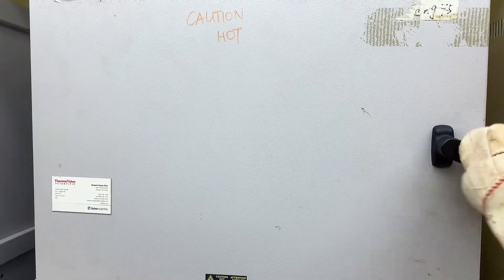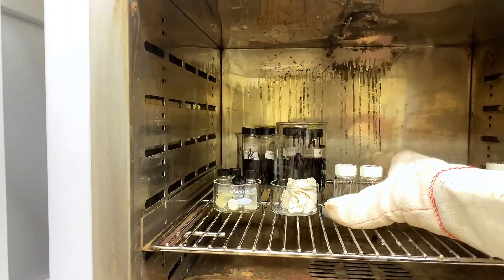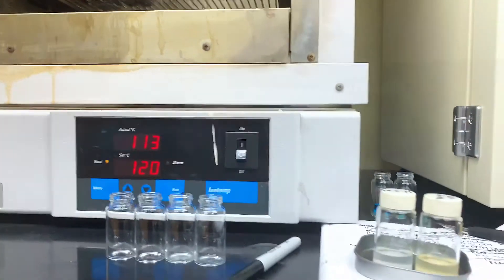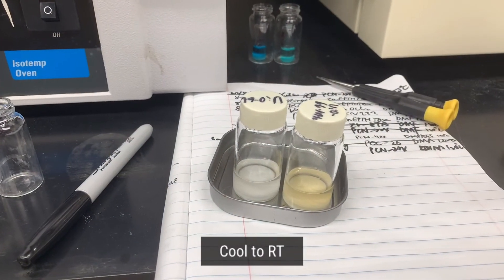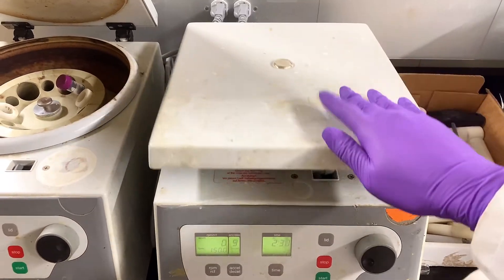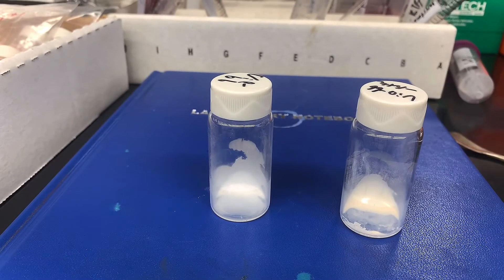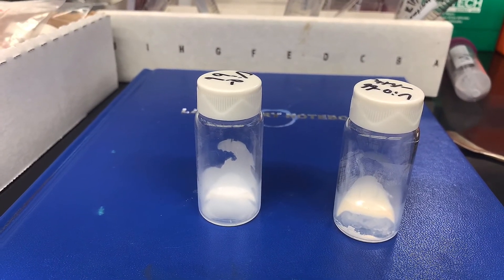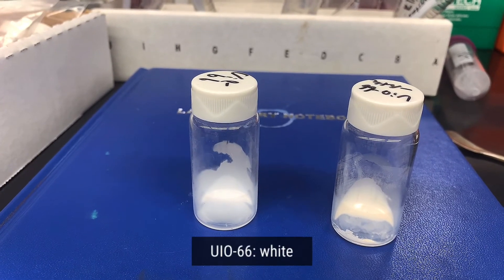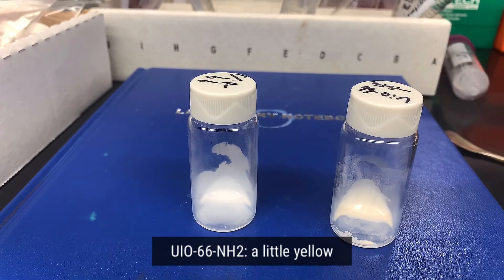After 24 hours, let's take the reaction out of the oven. The sample is cooled down to room temperature. After cooling, the UiO-66 can be purified through centrifugation. After centrifuge and drying, some powder will be achieved. For UiO-66 it has a white color, while for UiO-66 with amino function group, it's a little bit yellow.